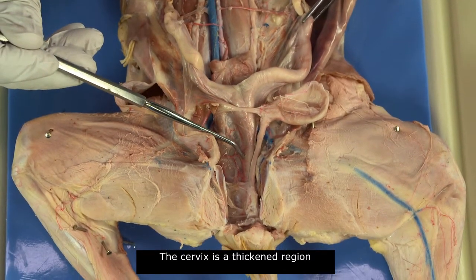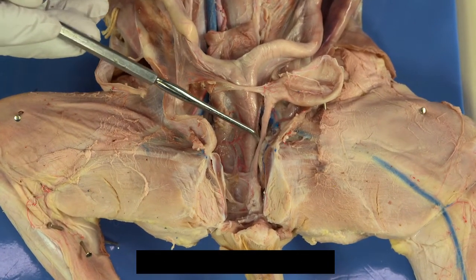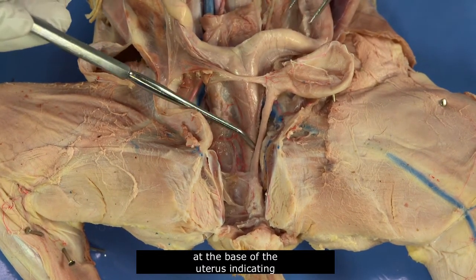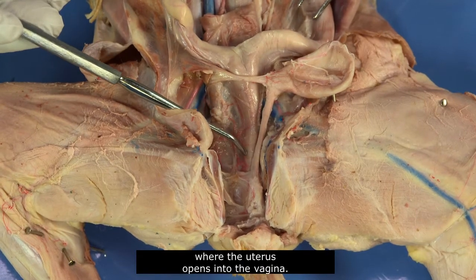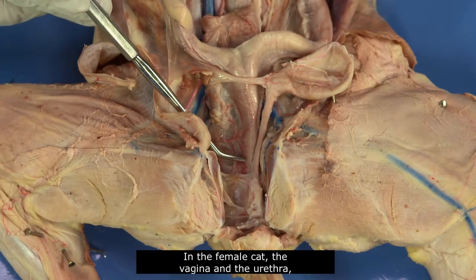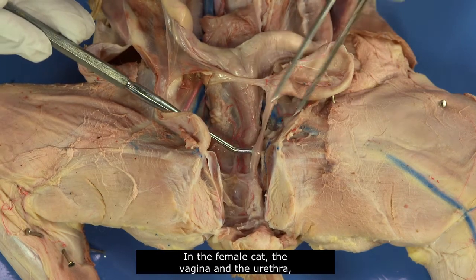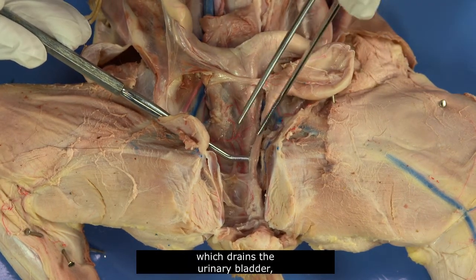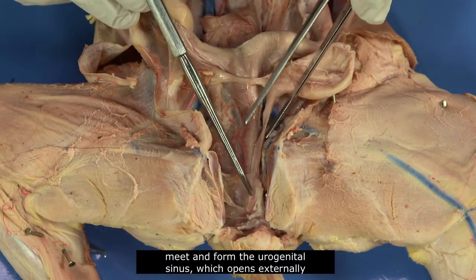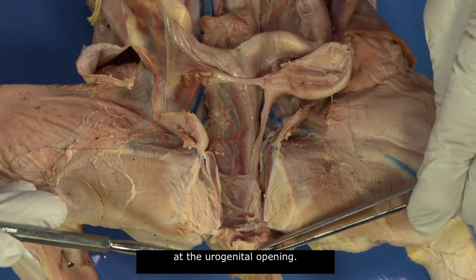The cervix is a thickened region at the base of the uterus, indicating where the uterus opens into the vagina. In the female cat, the vagina and the urethra, which drains the urinary bladder, meet and form the urogenital sinus, which opens externally at the urogenital opening.